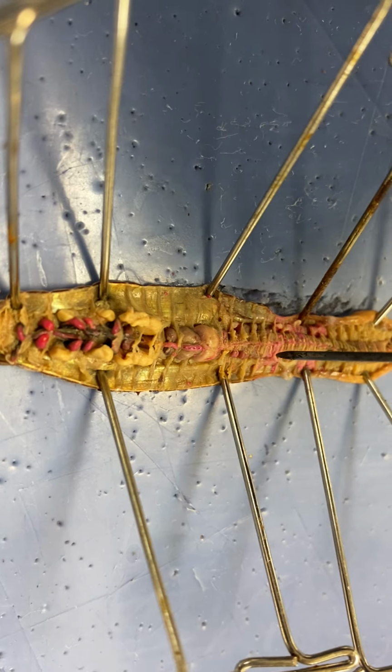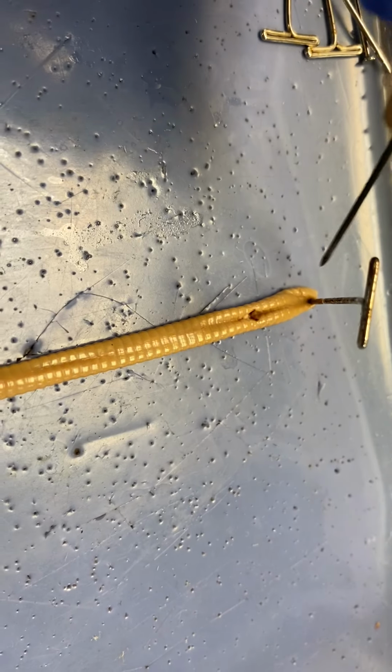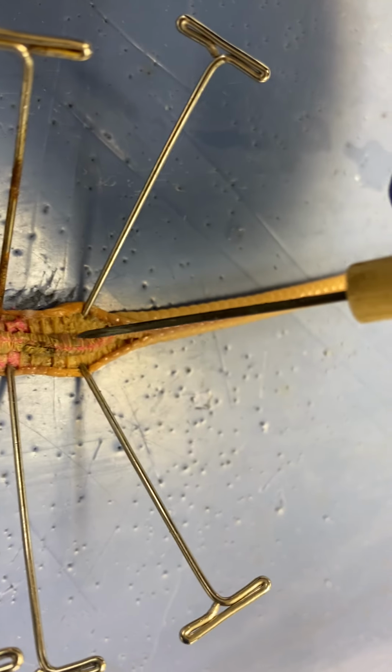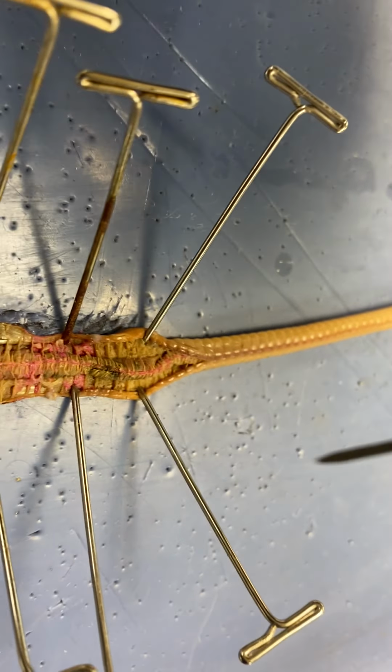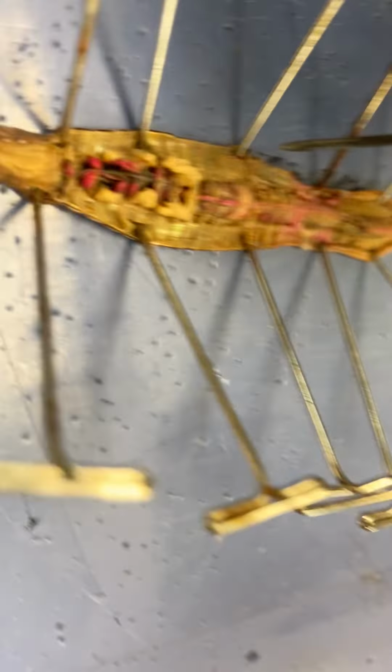And then the rest of this tube, that runs the rest of the body is the intestine, all the way to the very end with the anus. And that intestine will absorb all the nutrients that were broken down from the gizzard.